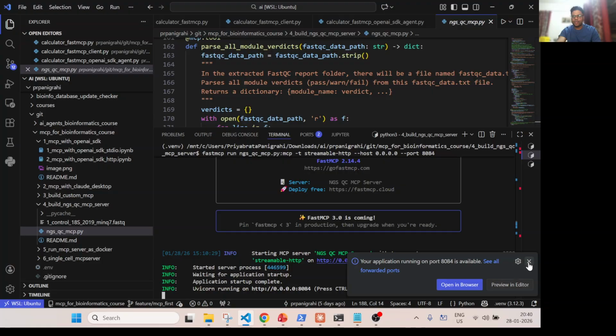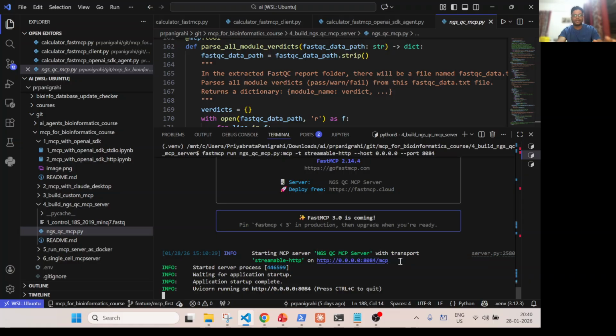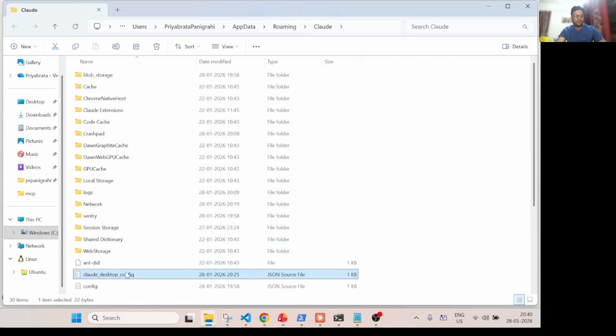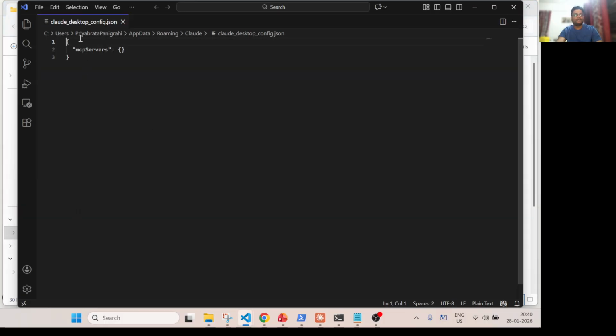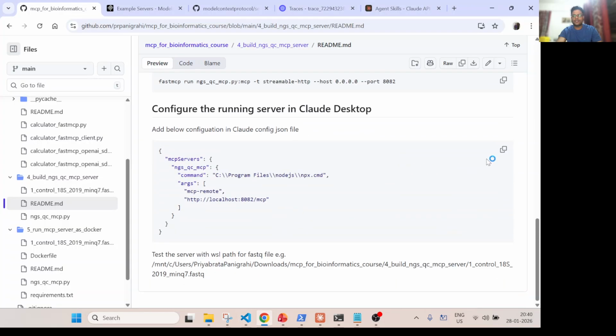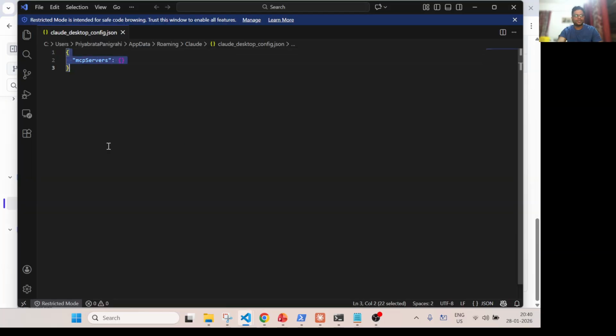Okay, so cool, I think it has started. Now you see this is running on port 8084. So what I'll do is go to my Claude Desktop settings, and then in the developer section I go to edit config. I've deleted my previous config, and when I double click, it will be empty like that. Now I'll just copy this command over here, this JSON block.